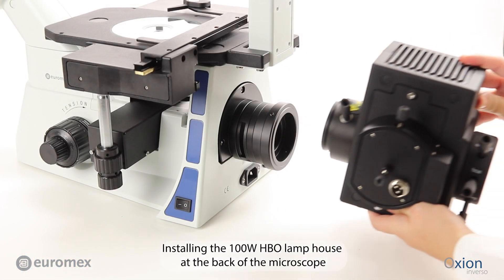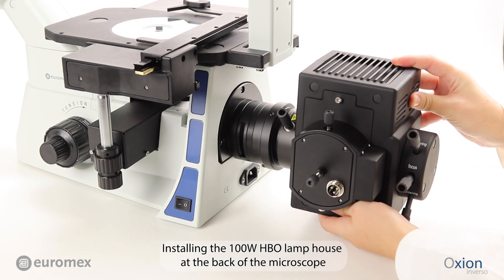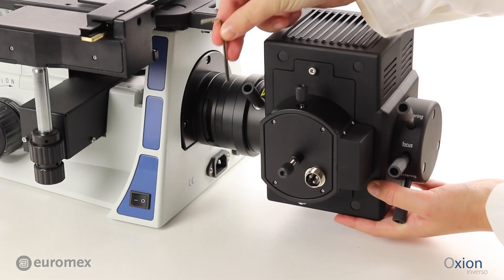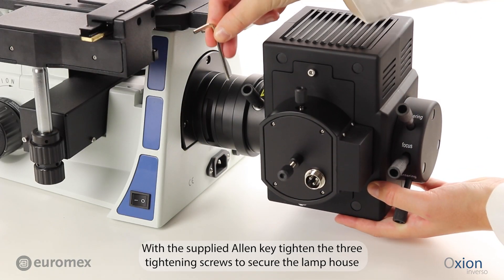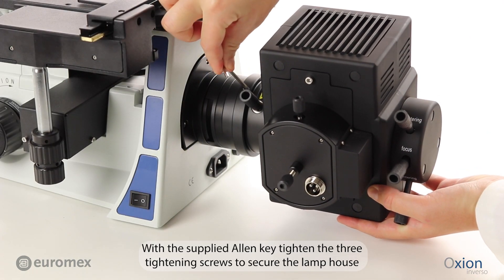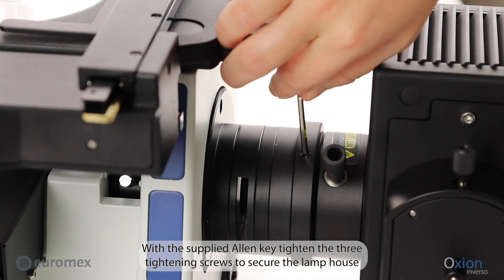Installing the 100W HBO Lamp House at the back of the microscope. With the supplied Allen key, tighten the three tightening screws to secure the lamp house.